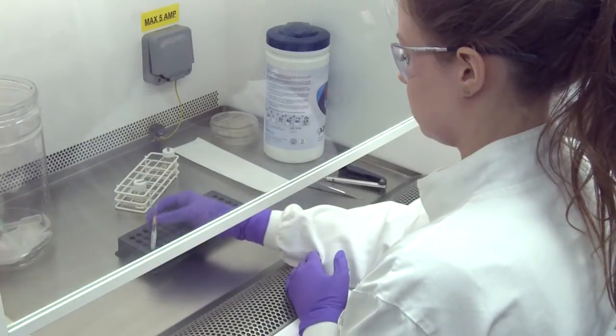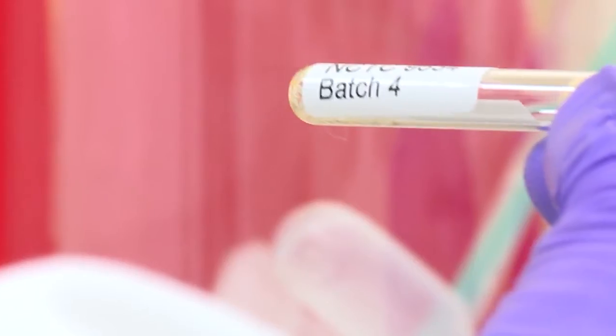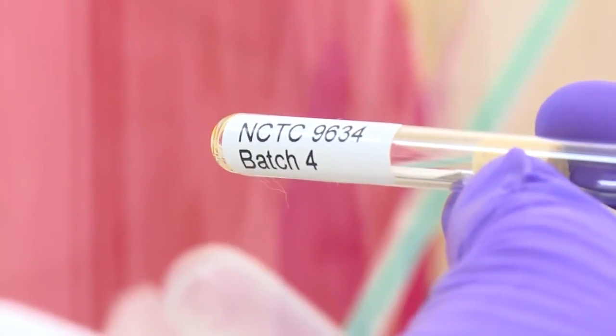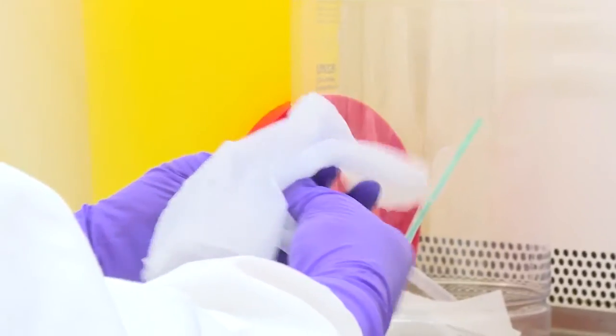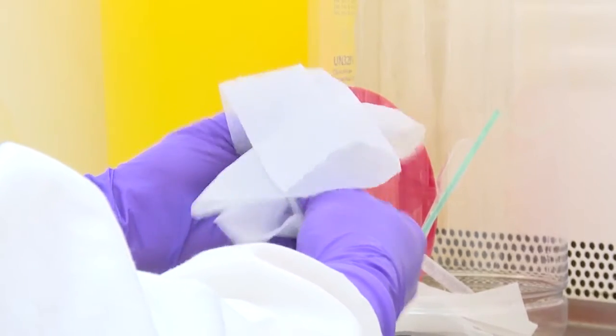Identify the culture by the number on the paper inside or the label outside of the ampoule. For opening ampoules by snapping, gently clean the outside of the glass ampoule using a suitable disinfectant.